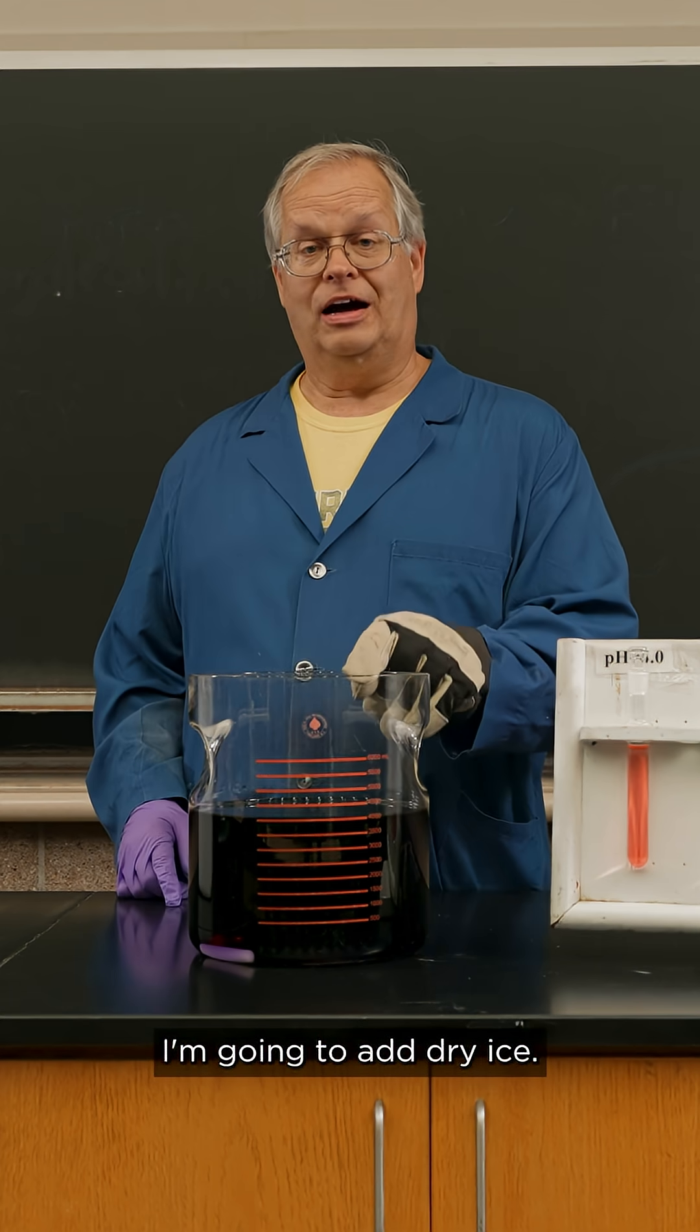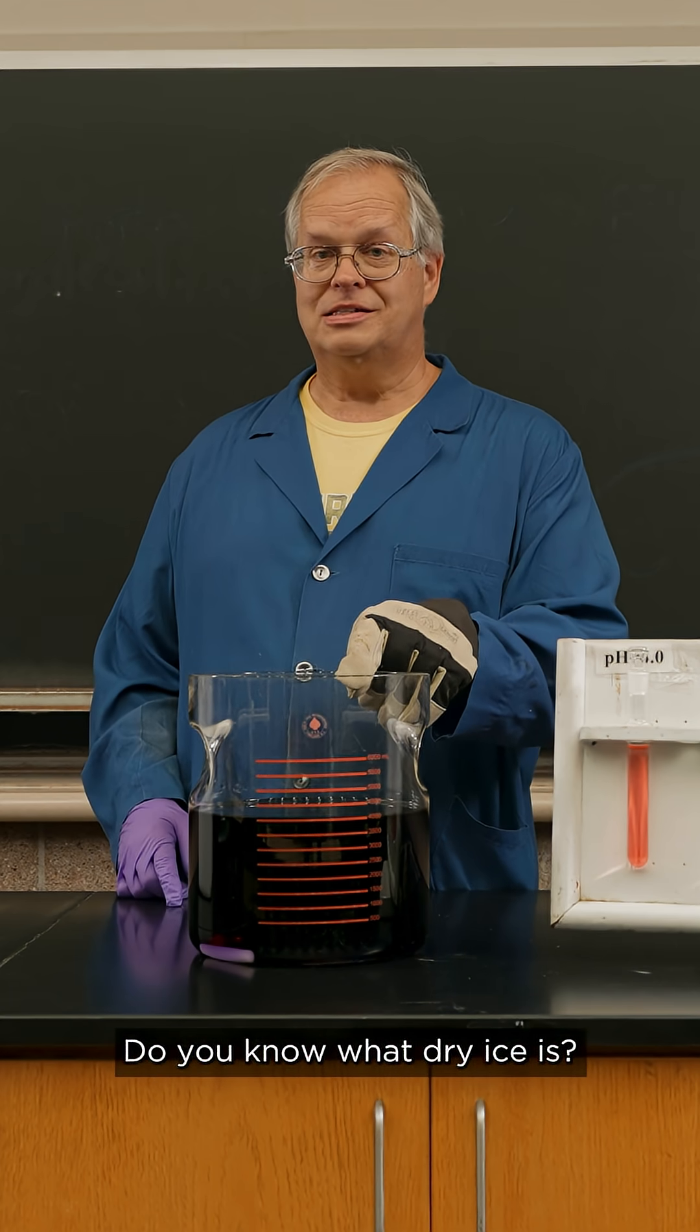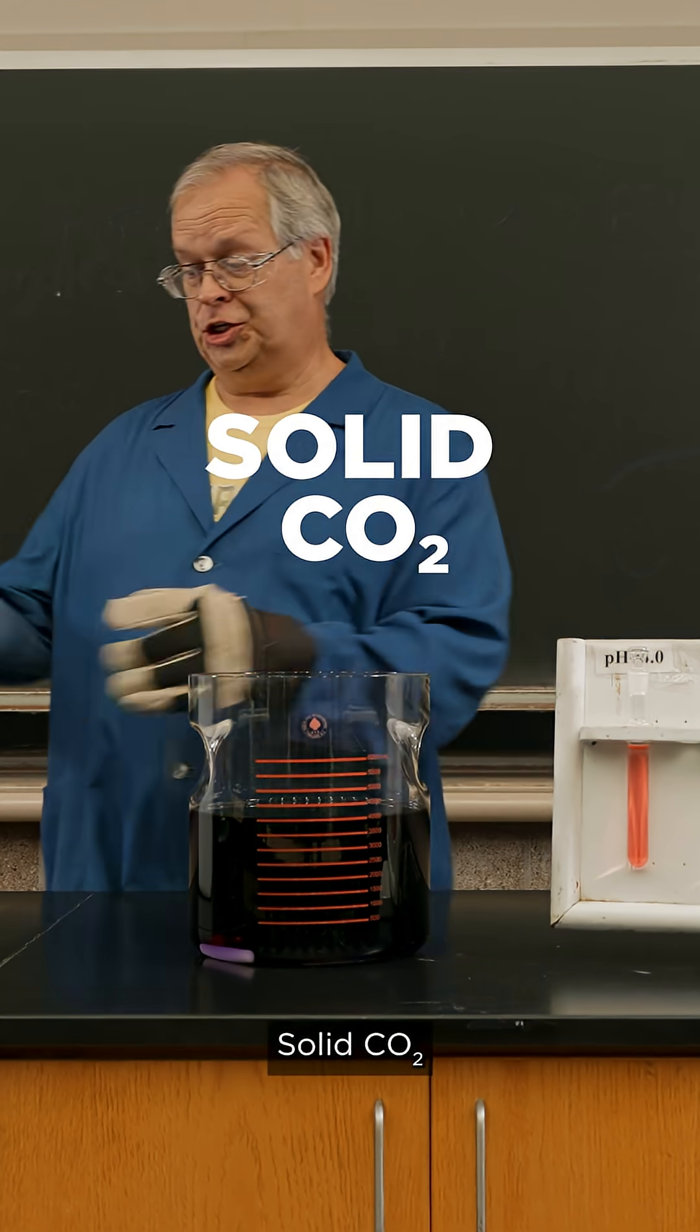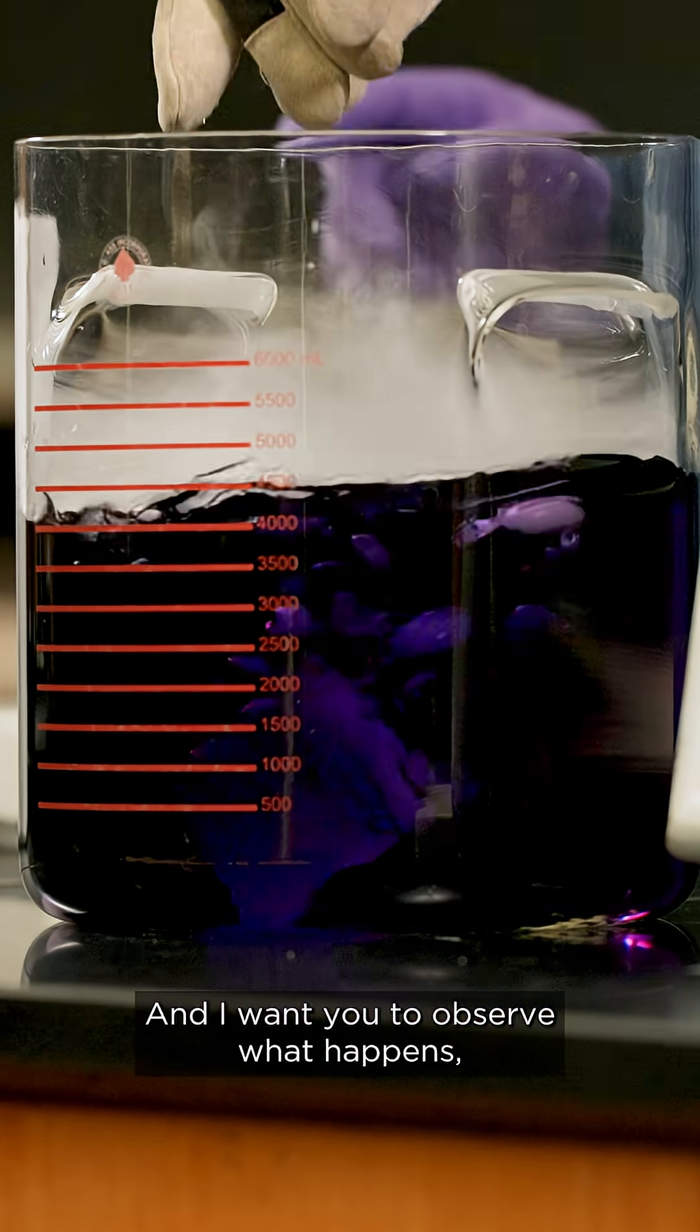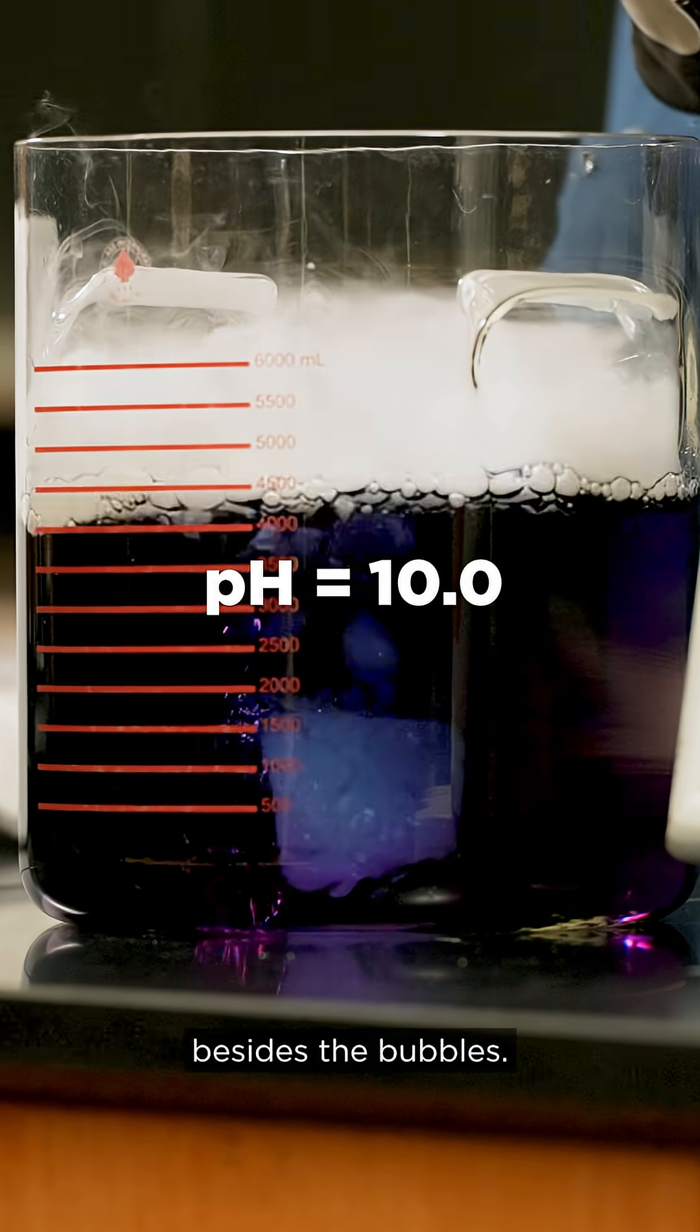I'm going to add dry ice. Do you know what dry ice is? Solid CO2. I want you to observe what happens, besides the bubbles.